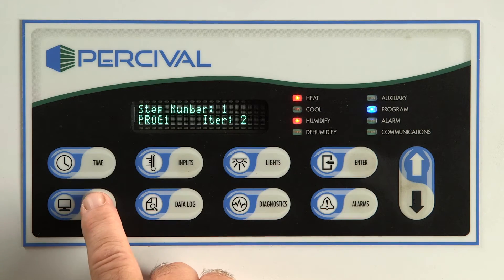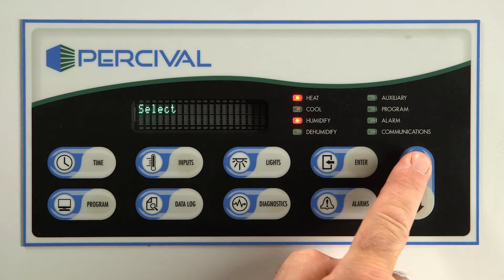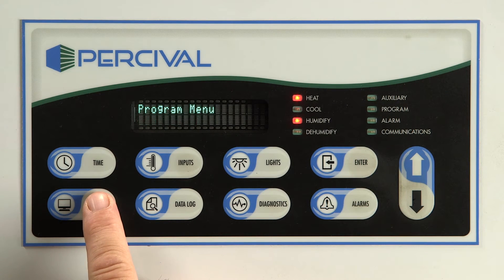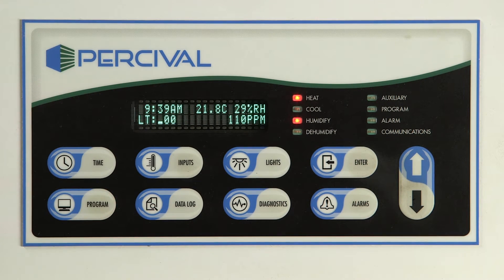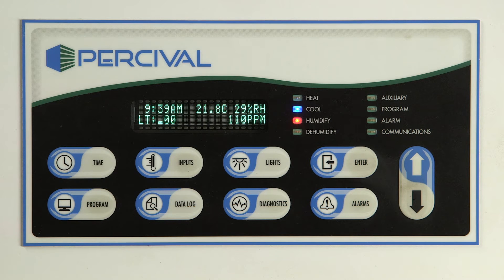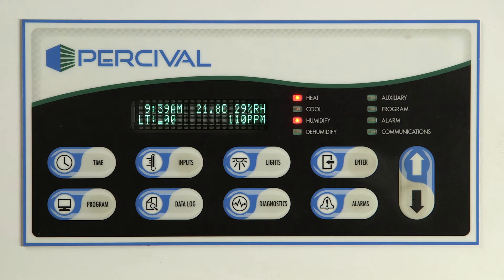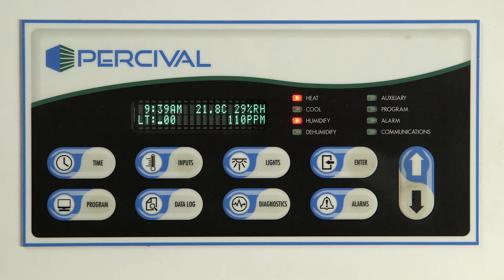In addition to the program types just described, there are four different programming modes. Please refer to the manual for more detail on how to change the programming modes. 1. 24-hour non-ramping mode will change the set point immediately between any two set points at the set time.